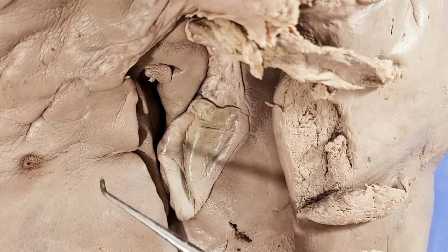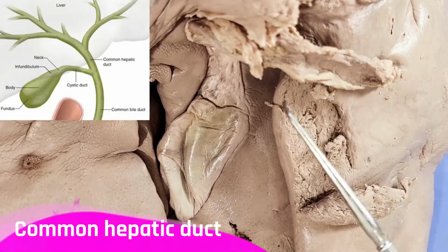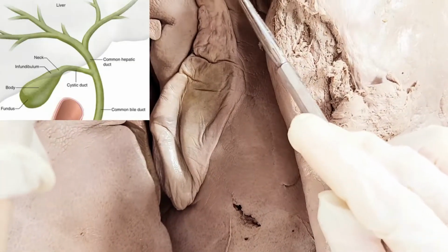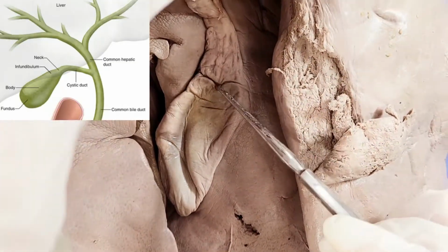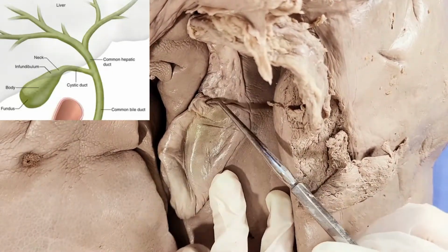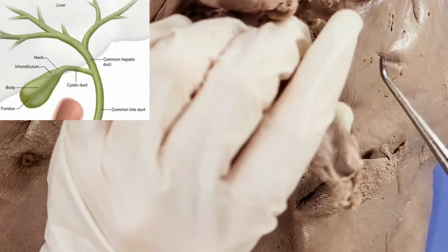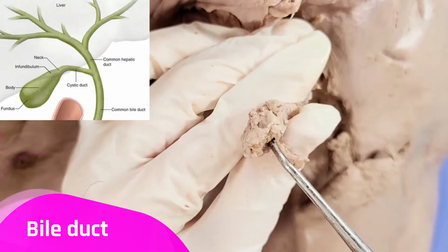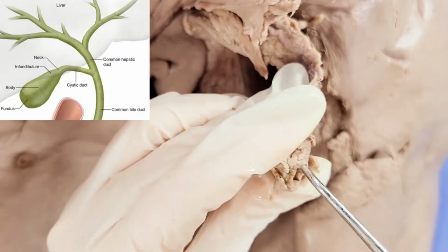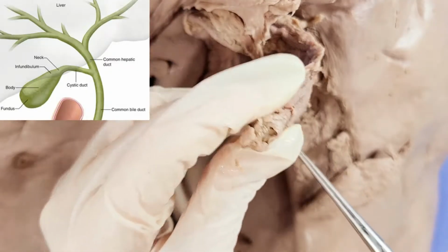So the bile is produced here in the liver and drains out of the liver through a passage called the common hepatic duct, which would be over here, but you can't really see it because of all the fat. And then it'll drain into the gallbladder here, and bile is green, which is why the gallbladder has this kind of greenish tint. After that, the gallbladder releases the bile through this passage called the bile duct. You can see it right here, and it still has some of that greenish bile in it. And the gallbladder releases the bile into the small intestine.